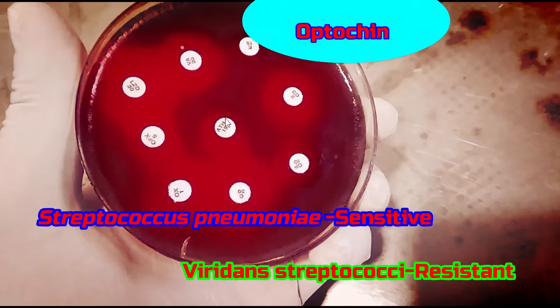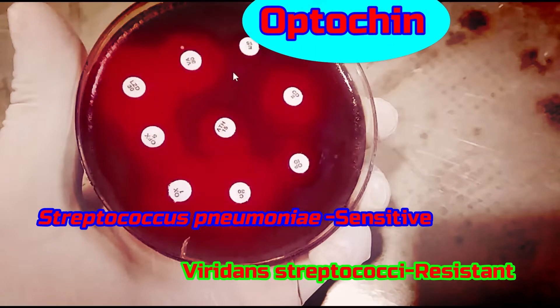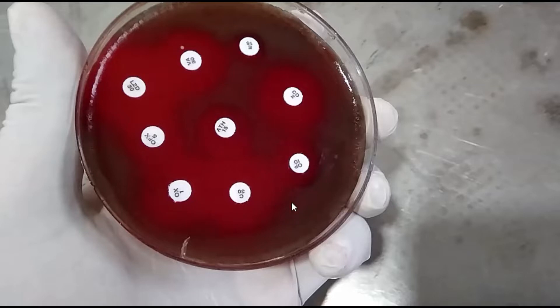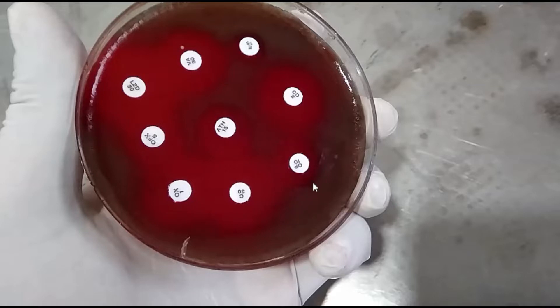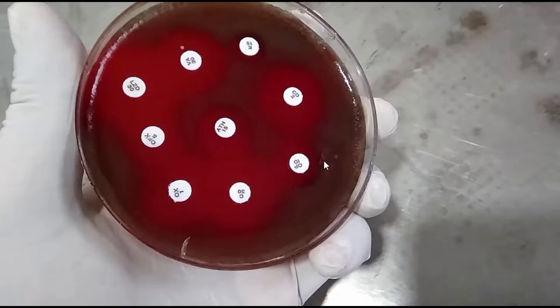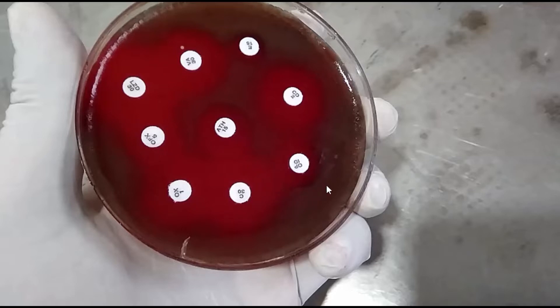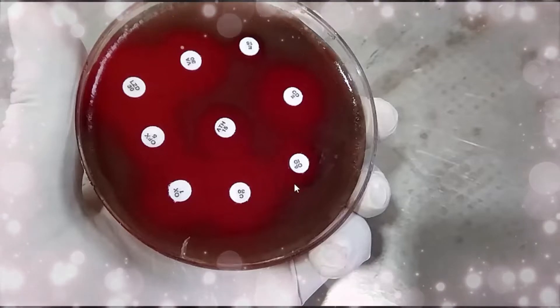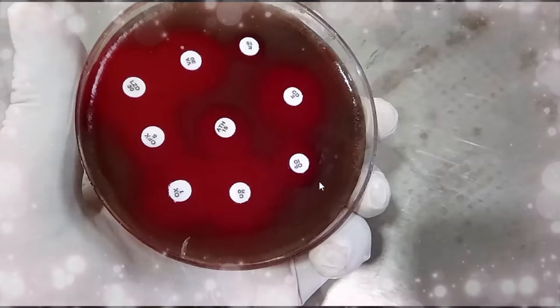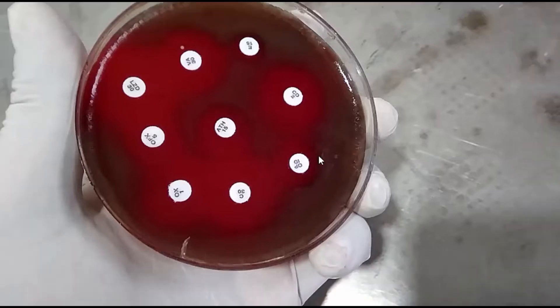Hi, let's learn about the use of optochin. Optochin is used for the differentiation of Streptococcus pneumoniae from viridans streptococci.